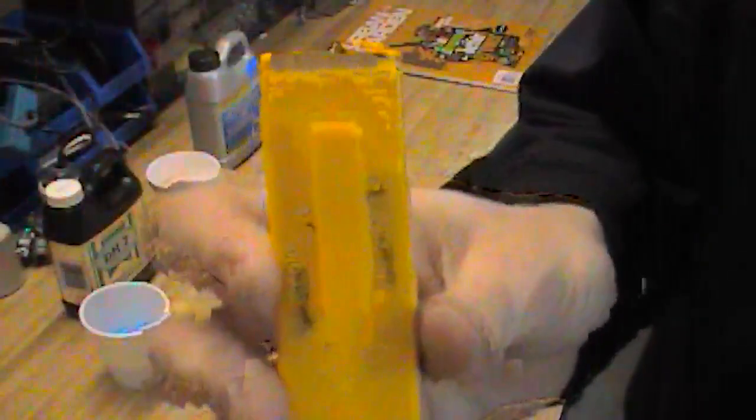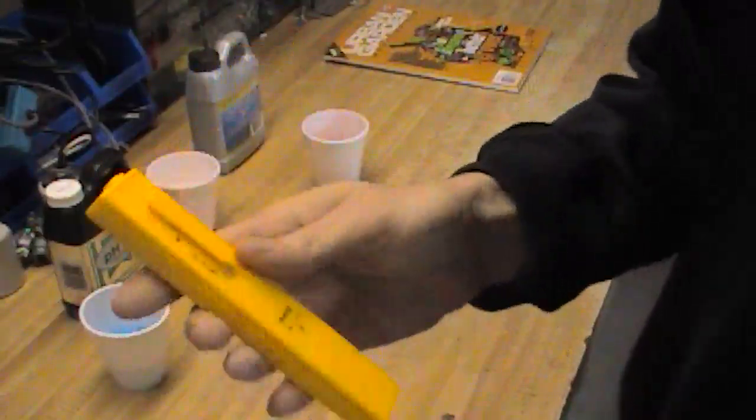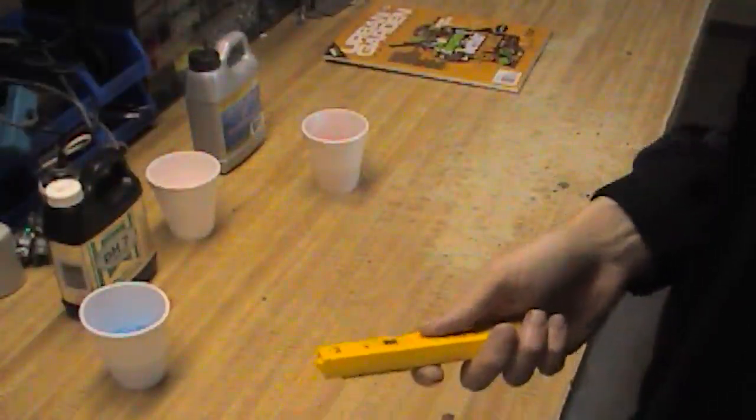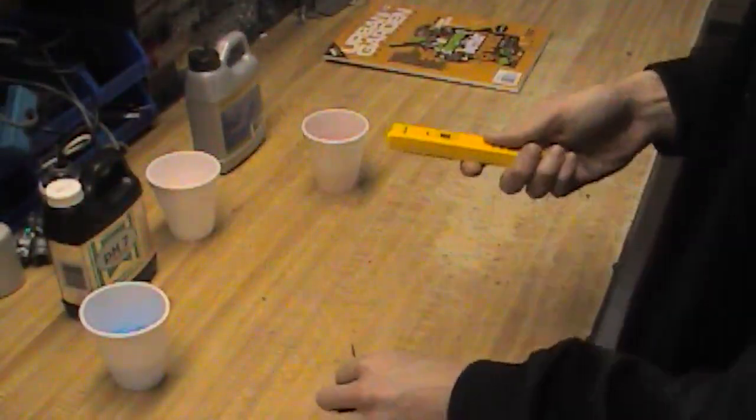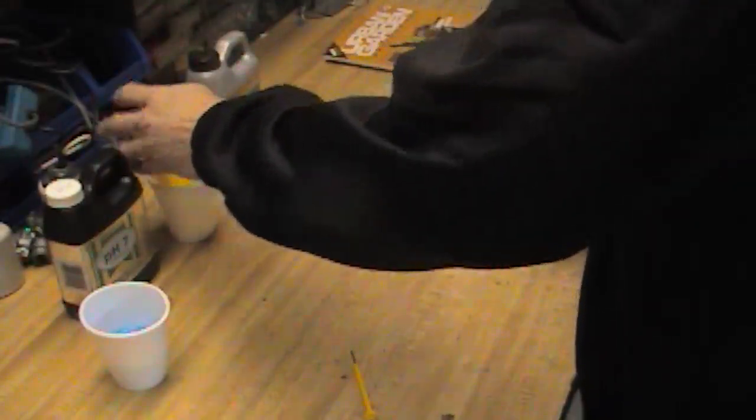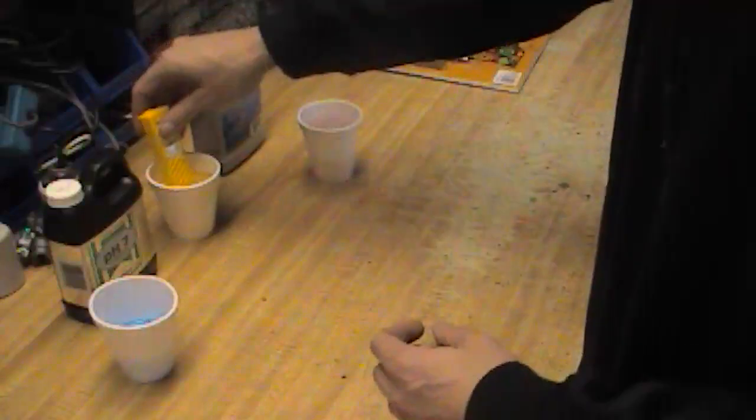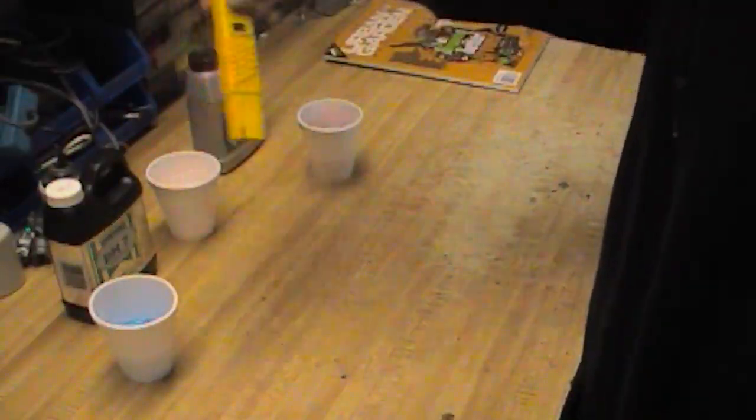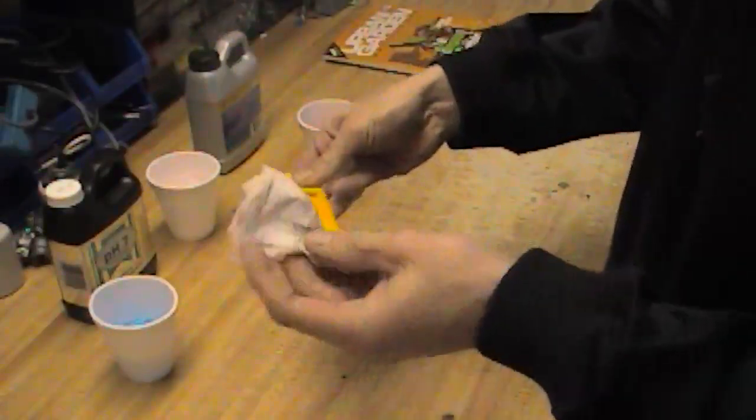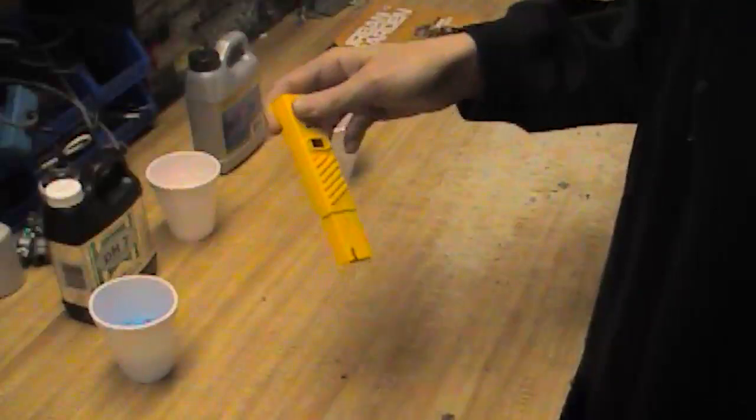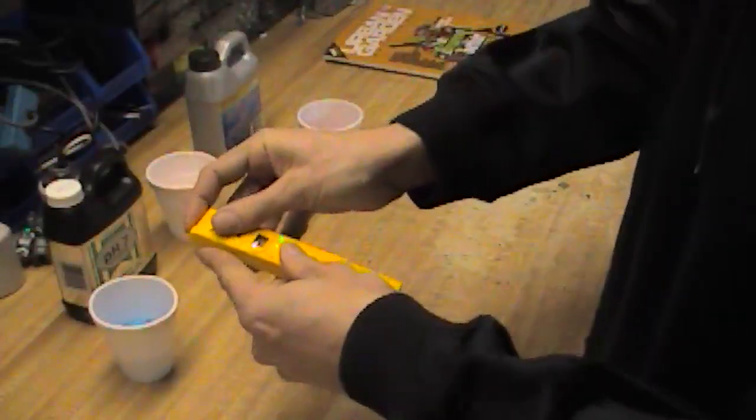Just like that. So this one here, again, screwdriver generally comes with the unit. Just gonna soak that electrode for a sec. All right, now we've let this model soak in plain water here for a little bit. Let's see how she is reading.